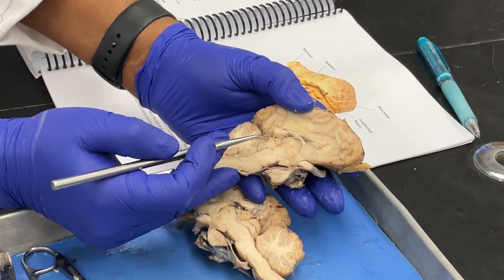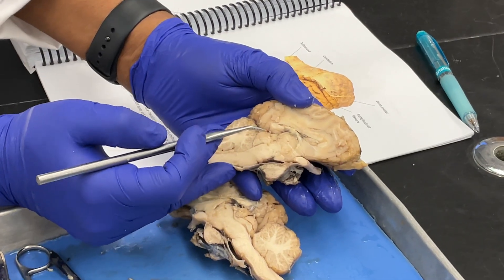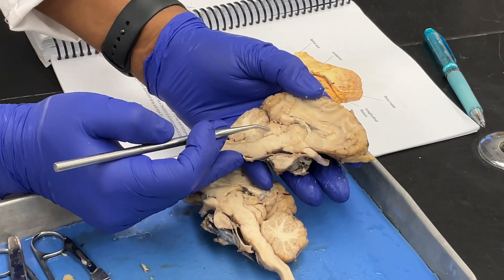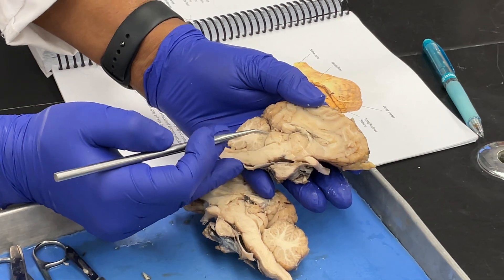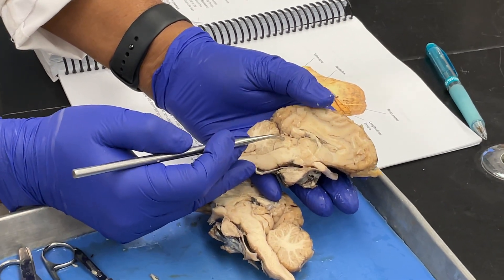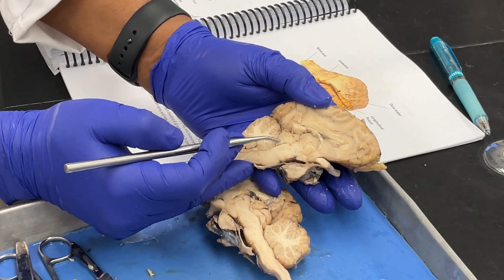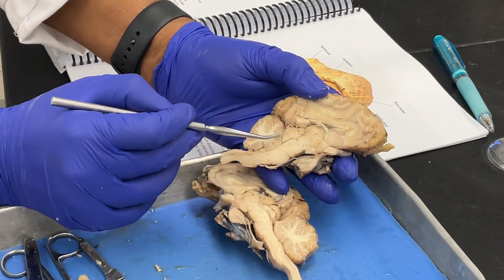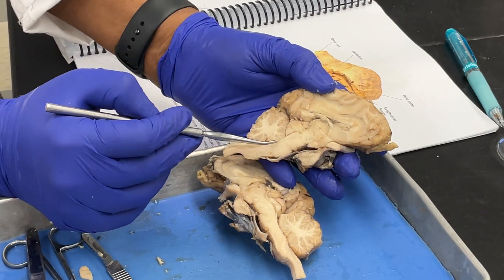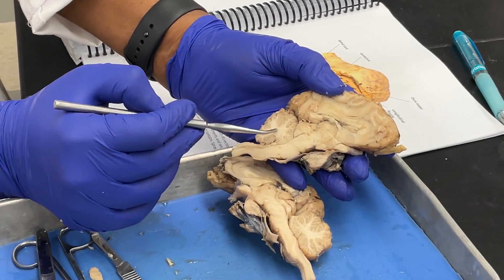The superior colliculus is involved in your visual reflex — so if you see a flash of light and you suddenly look at it, that's happening here. The inferior colliculus is involved in the auditory reflex — if you hear a gunshot and you turn your head, that's happening here.